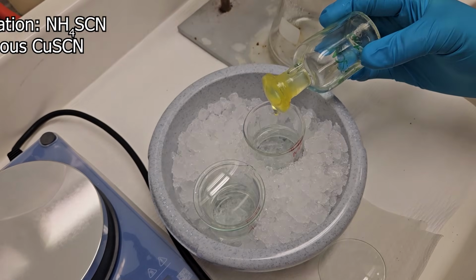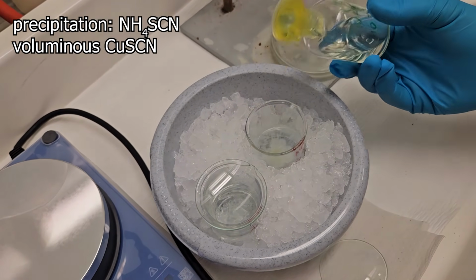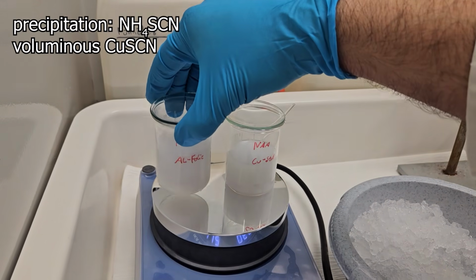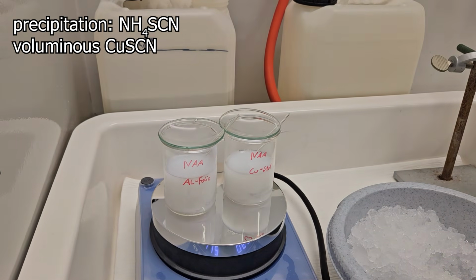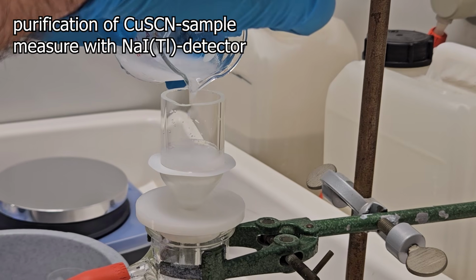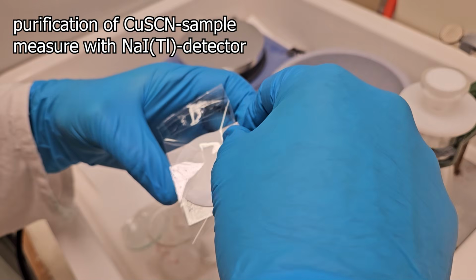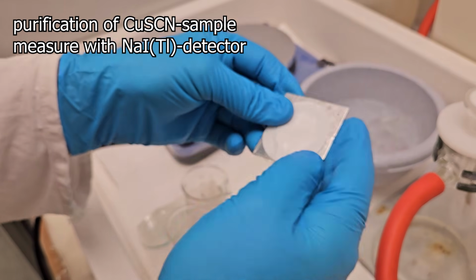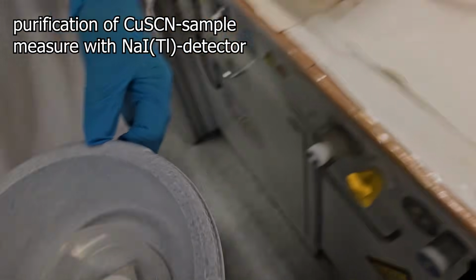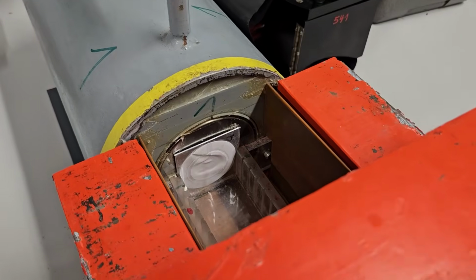It is then heated to boiling using a boiling rod to prevent delayed boiling and then left to cool again. This ensures that the precipitate clumps together more effectively and then can be filtered out more easily. Using the ammonium thiocyanate solution, we obtain a voluminous copper 1 thiocyanate precipitate. This is then washed with thiocyanate solution and sulfite solution and sealed in a vial to measure it using a scintillation detector. So what happened in the reactor?